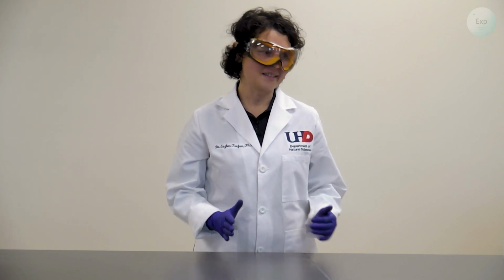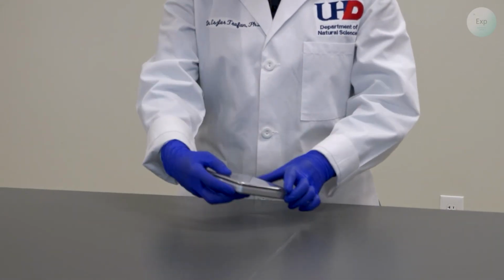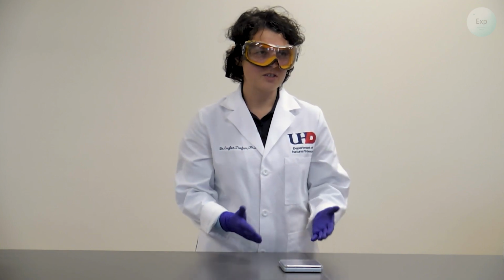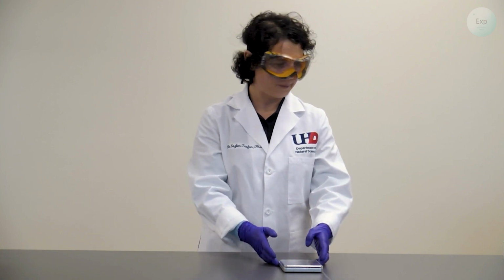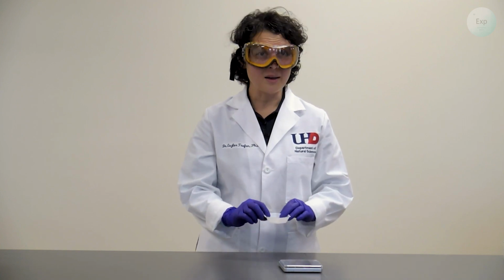Dr. Esther Trufan, and in this video, I'm going to demonstrate how to use a simple scale. For this part of the experiment, we're going to use this scale, which is a fairly straightforward instrument. An instrument is anything that gives us a number for a measurement.